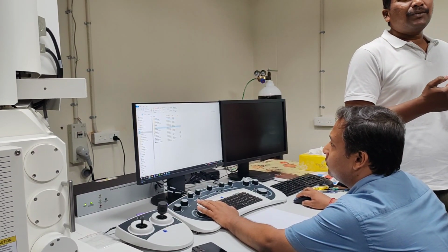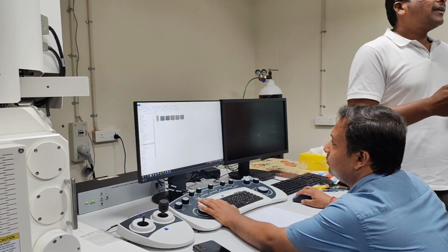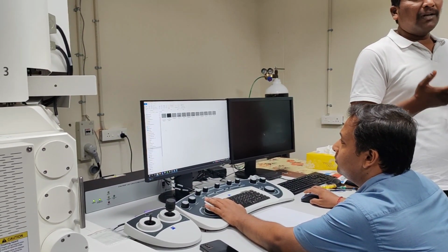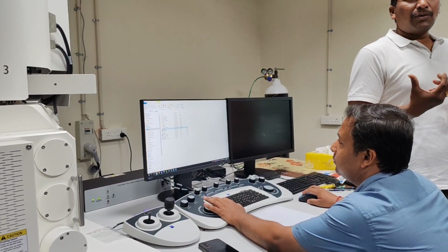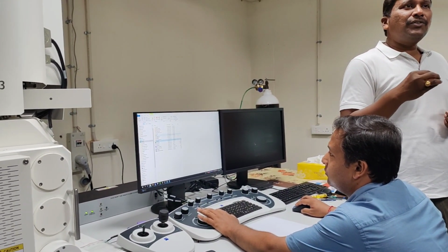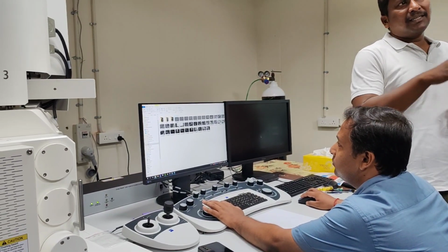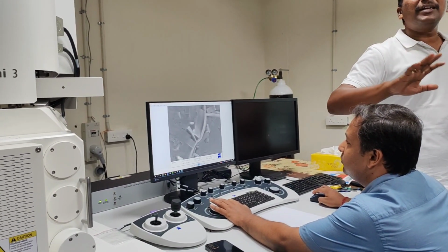If you have liquid samples also, don't be confused that the SEM can give analysis for liquids also. If you freeze those samples through this cryo or cooling stage, you can even visualize the solid particles inside that liquid material. That's a way to handle different difficult samples.